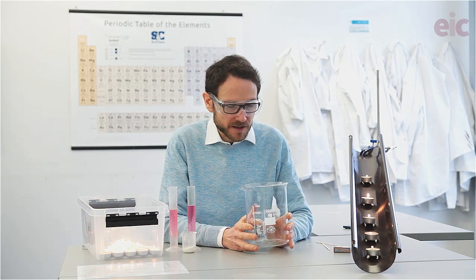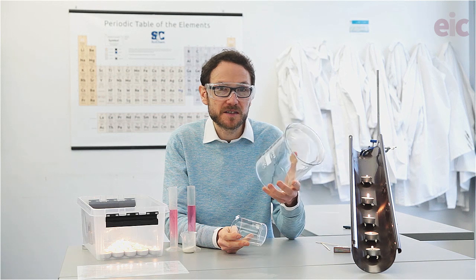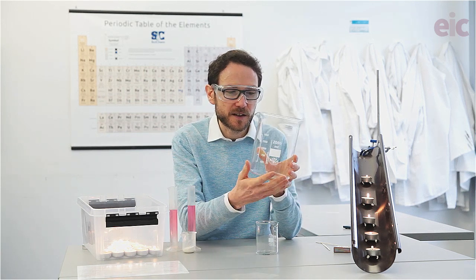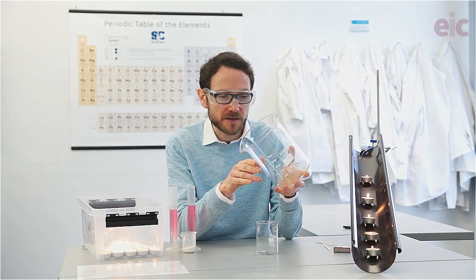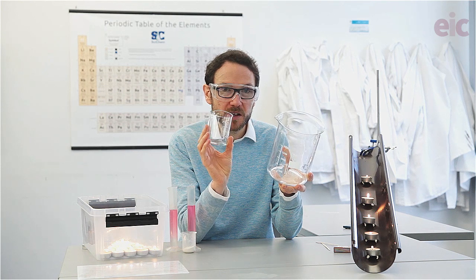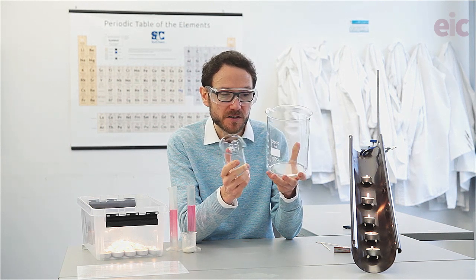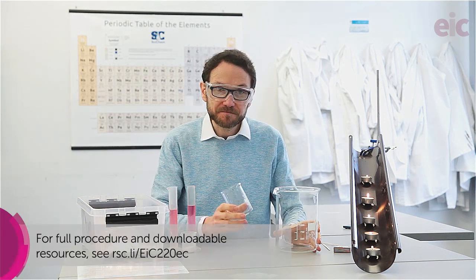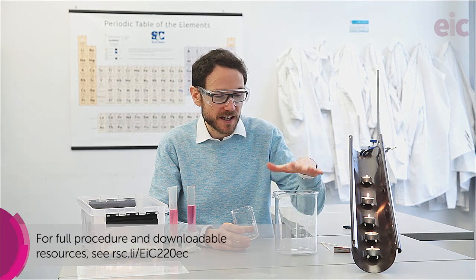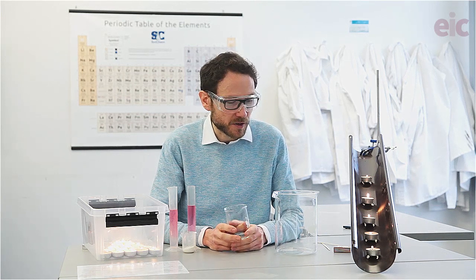We're going to have a look at a couple of different alternative ways of doing this demonstration. In its simplest form, of course, you can just put some calcium carbonate and some acid into the bottom of a beaker and pour it out over a candle. But a lot of the time you might find that if you've got liquid in the flask already, you can end up dripping some of that out — you have to be a little bit careful as you're pouring, and that loses some of the visual appeal. So this time we're going to put some calcium carbonate into a smaller beaker inside a larger beaker and play around with just the carbon dioxide we're producing. I'm going to be using 10 grams of calcium carbonate, which if completely neutralized will produce about two and a half litres of gas. I've got a two litre flask here — you can scale up or down according to your situation.